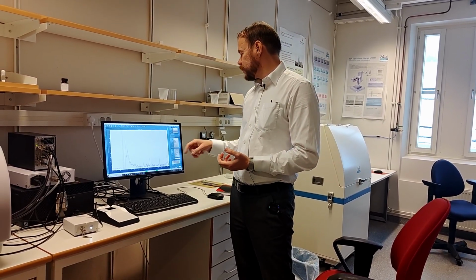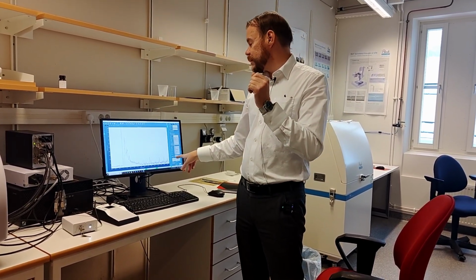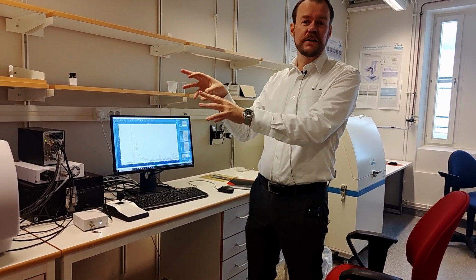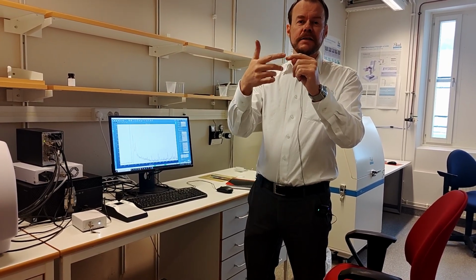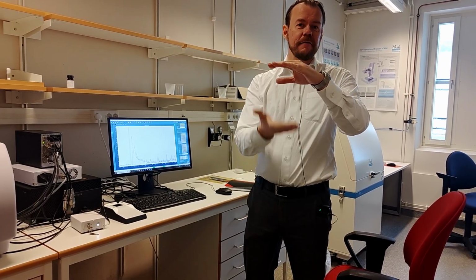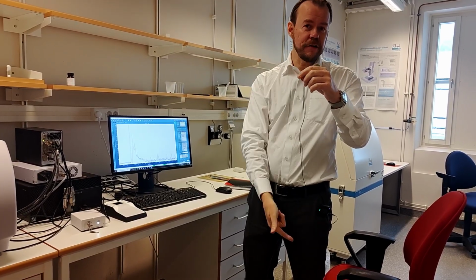If you have it on 100, that means you get the information from where the focus is. If you increase it to 500, that means you basically remove the confocal feature of the microscope, and then the signal comes from all paths the beam actually hits. And sometimes you want that, because if there's the same material everywhere, then you don't want to remove signal by taking signal from just the focus point. You can just take everything then.